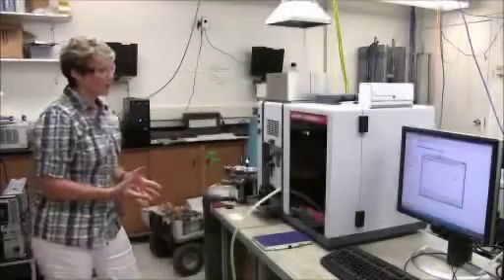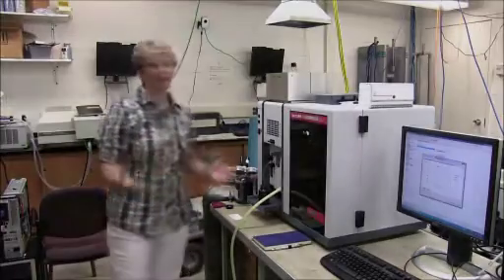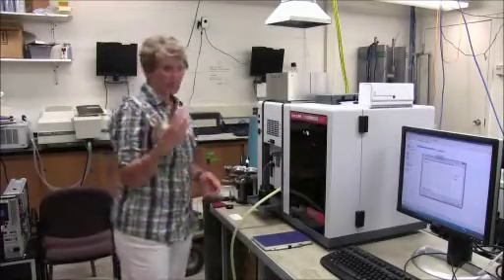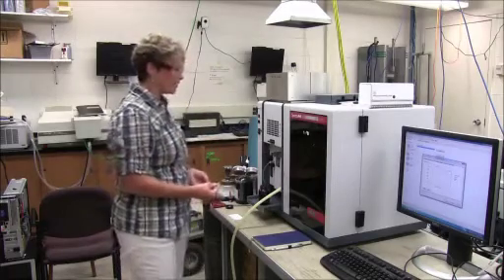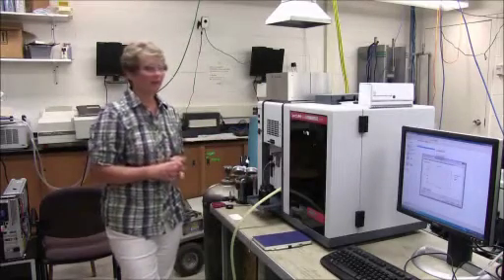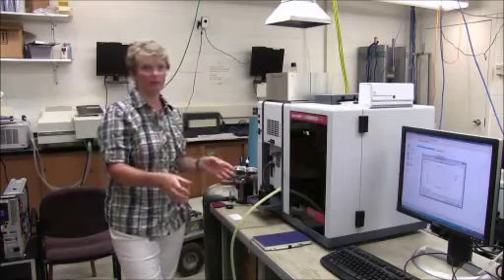When you're ready to run your samples, the very first thing you're going to want to run is a set of calibration standards. So for your calibration solution, you will start with your stock concentrate, say it's a lead solution, and then do a serial dilution of those. Five solutions is probably optimal. That will cover the range that you're assuming your samples will fall in.